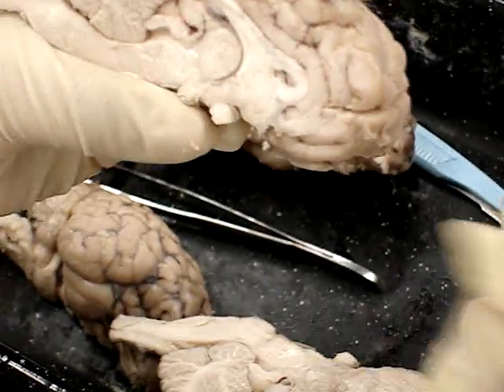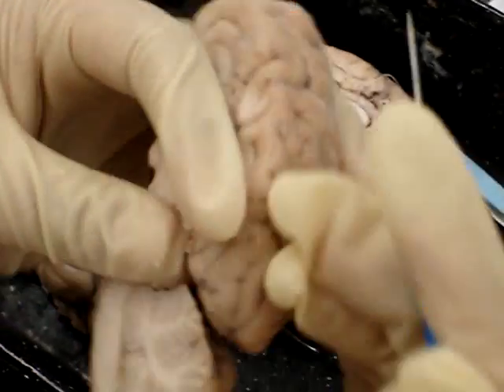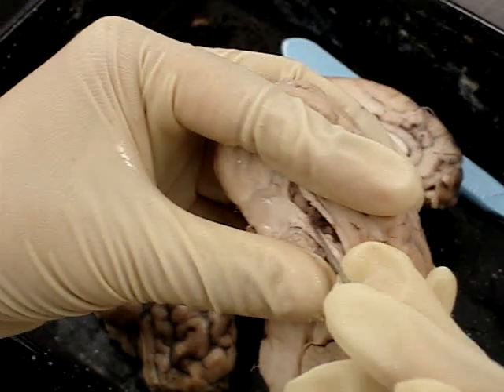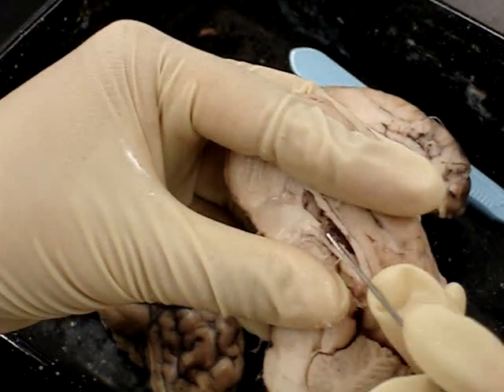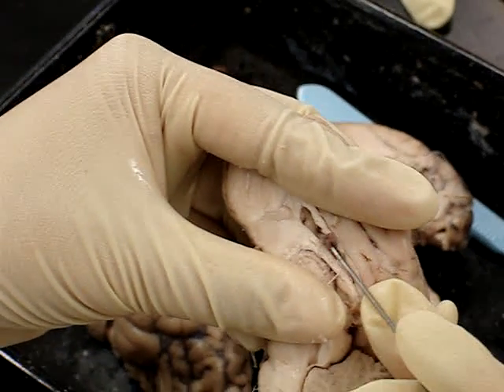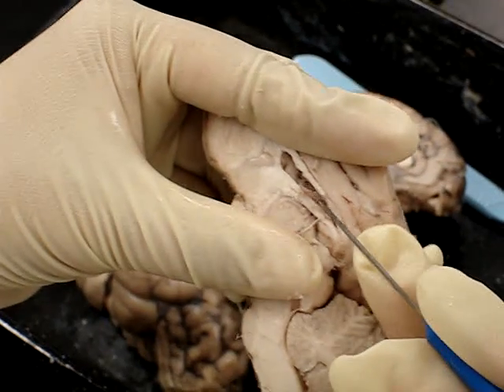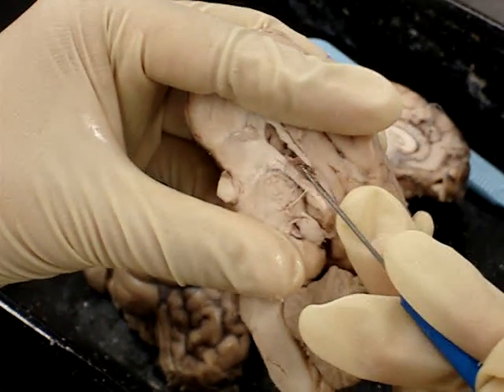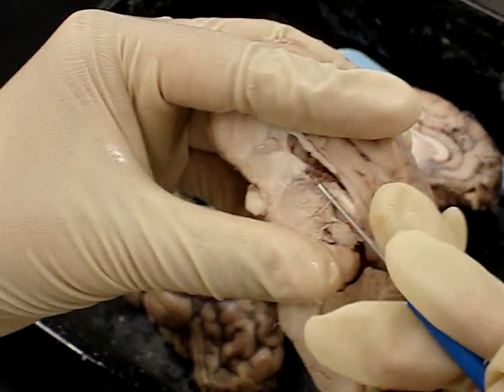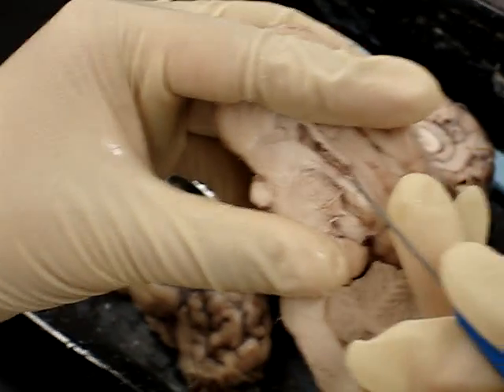Choroid plexus can be located inside the ventricles. It's this dark brownish colored thing. It's located in all the ventricles, and it produces cerebrospinal fluid.